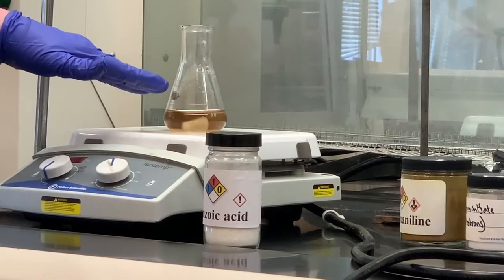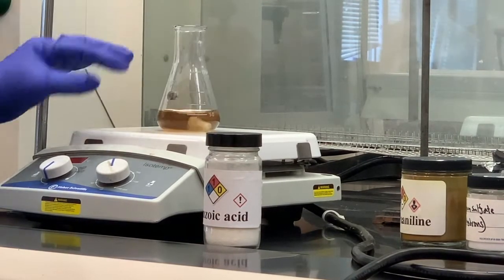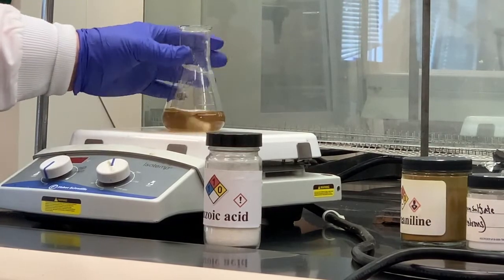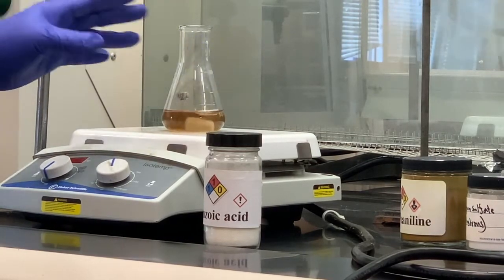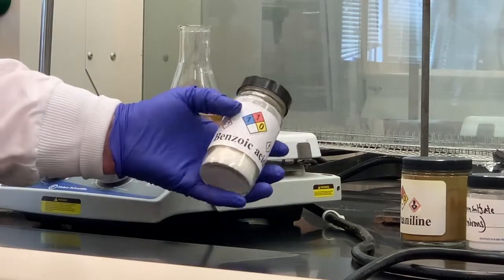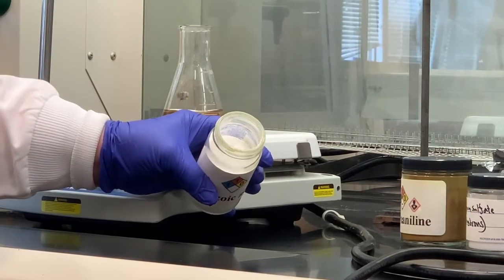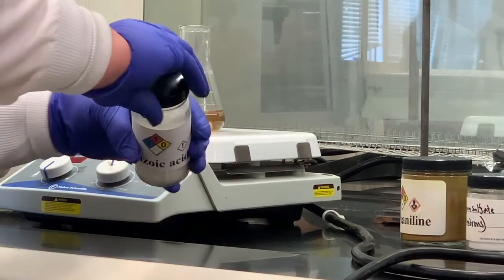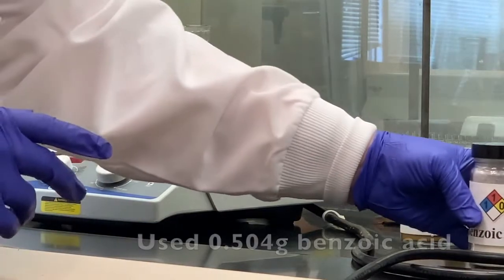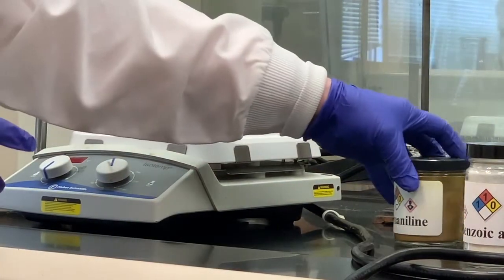While this is stirring to dissolve, I don't need to add any heat to this. I'm just using the magnetic stir bar to facilitate the dissolution. But I wanted to show you what these individual substances look like initially. This is our benzoic acid, and you can see a white crystalline solid. And the benzoic acid, I used 0.504 grams of that.